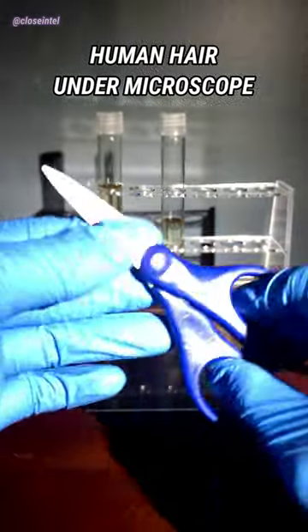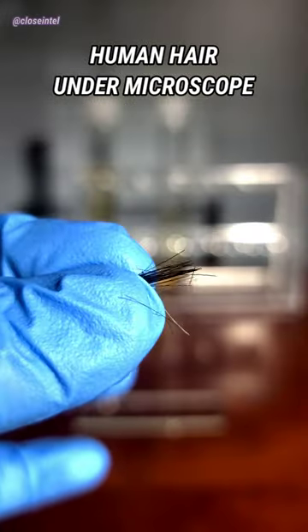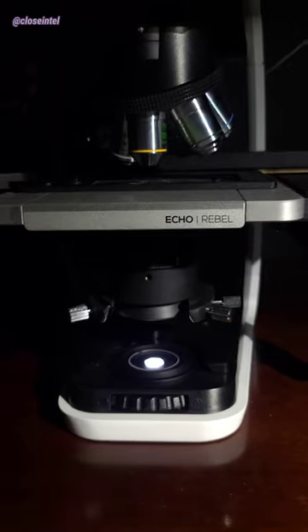Today I'm going to show you what human hair looks like under the microscope. I got a sample from the top of my head and put it onto a slide with some distilled water. Let's take a look and see what we can find.